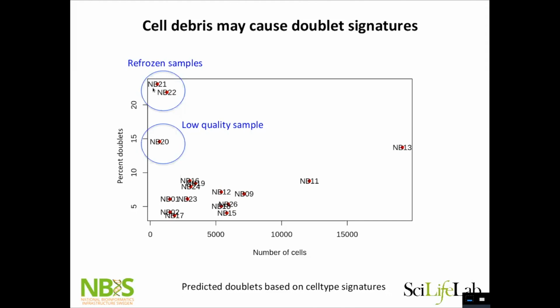But then these 2 samples really stood out. And when I talked to the people in the lab, it turns out they had a problem in the lab, and they had to refreeze the cell suspension. And then they took it the day after and loaded it onto 10x. And basically, I think they just ended up with a lot of cell debris sticking to the other cells. And this one also has lower quality when it comes to all the quality metrics. So there is one more reason to really make sure you have good viable cells to work with: you get more doublets, or it's not doublets, it's a 1.5 cell, I guess.